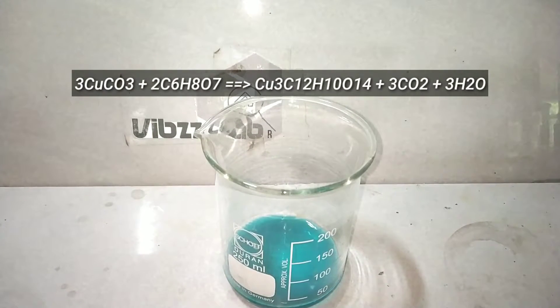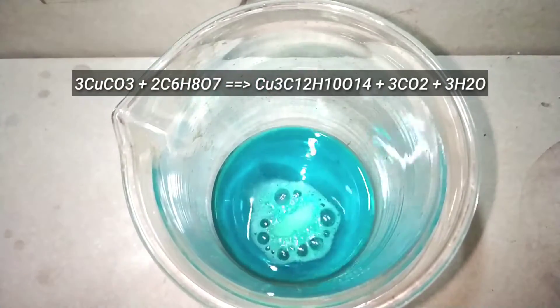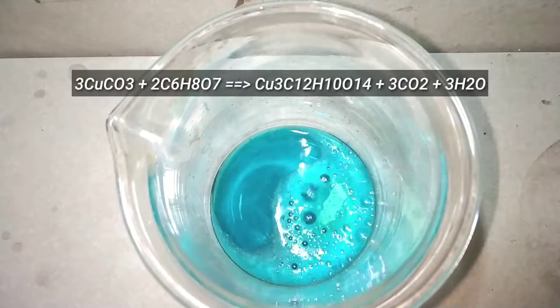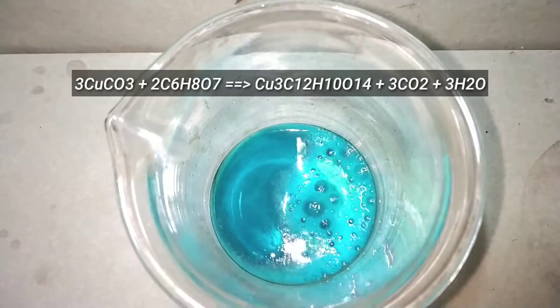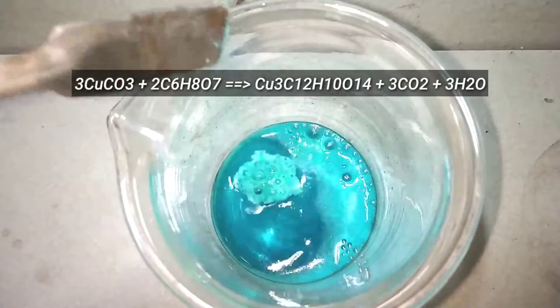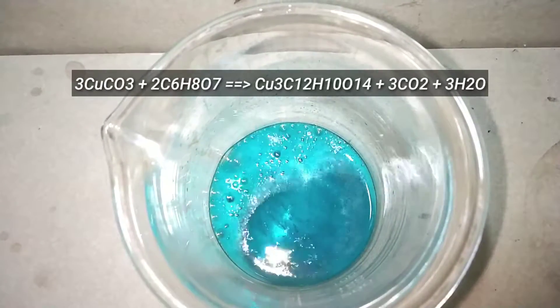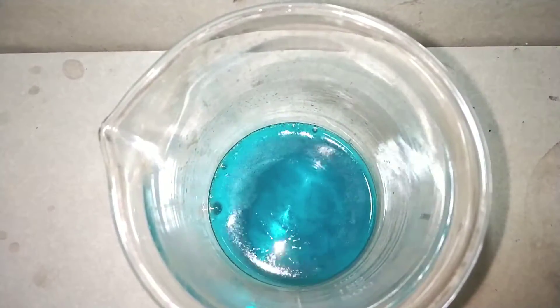This is the reaction: three molecules of copper 2 carbonate reacting with two molecules of citric acid to produce the copper 2 citrate. The color of the copper 2 citrate is also blue to green in color, so there won't be any very noticeable color change.